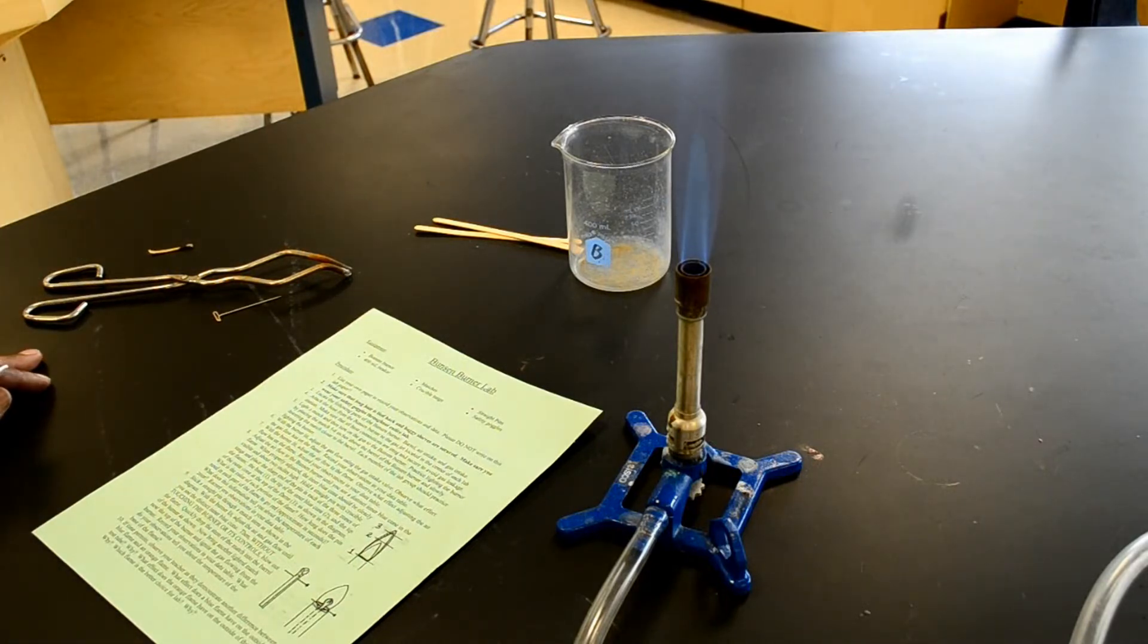Then it says each member of the lab group should practice lighting the burner. Let's assume that there are four members in my group, and all four of us have lit the burner successfully.